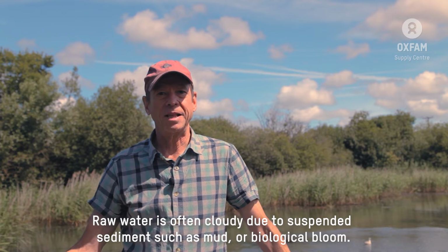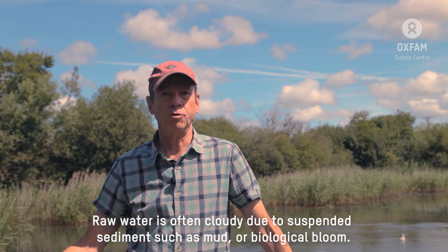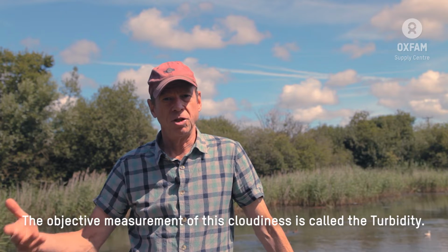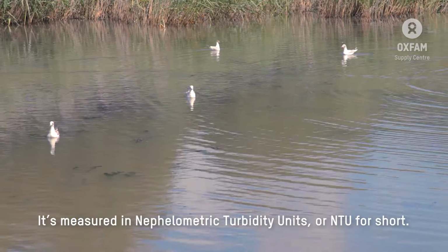Raw water is often cloudy due to suspended sediment such as mud and biological bloom. And the objective measurement of this gives you the turbidity. It's measured in nephelometric turbidity units, or NTU for short.